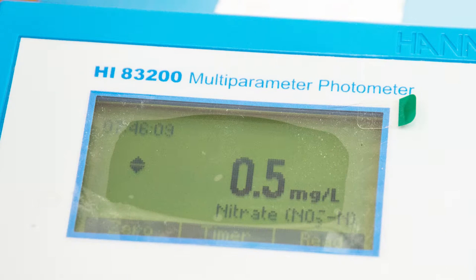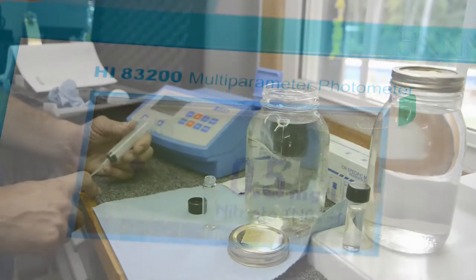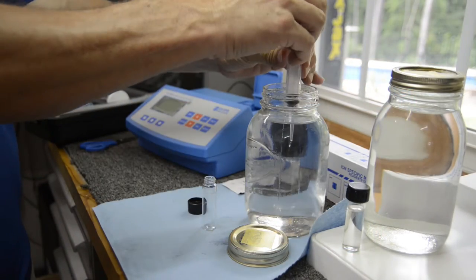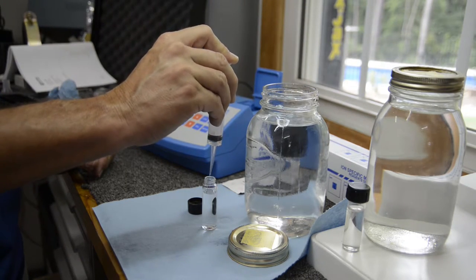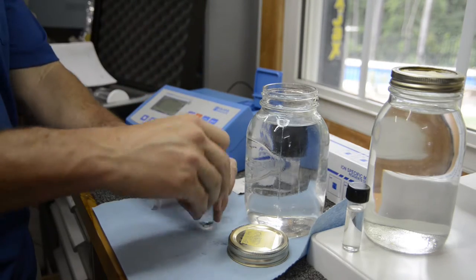So here's our control - we're at 0.5 milligrams per liter of nitrate in our control. This is without bubbling. 0.5 is the same as 0.5 parts per million. So now that we're all experts on photospectrometry - I can't even believe I said that right!